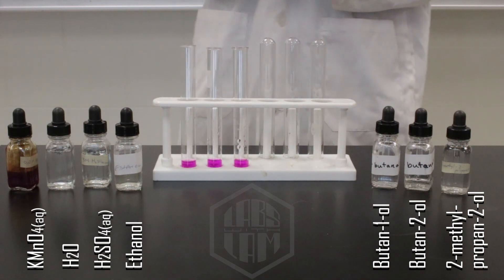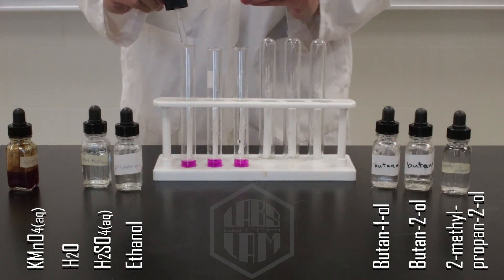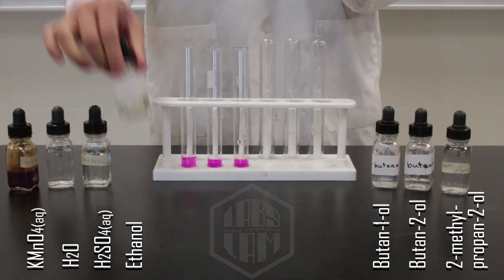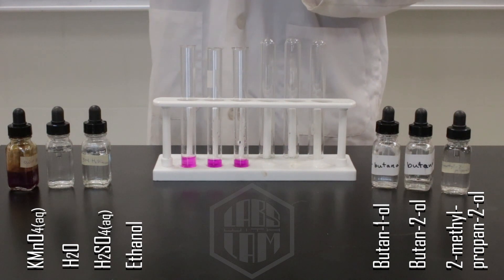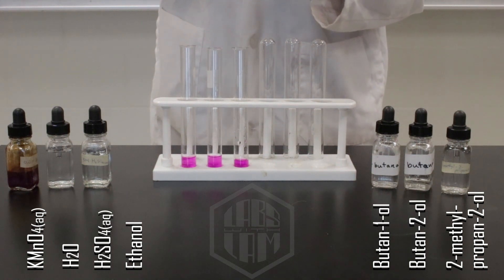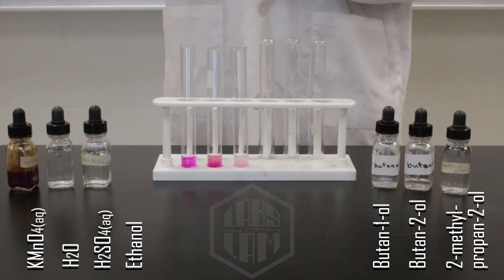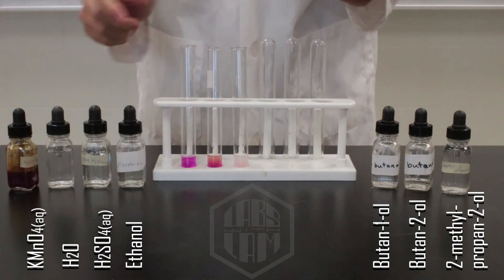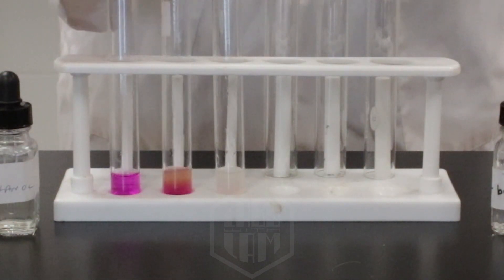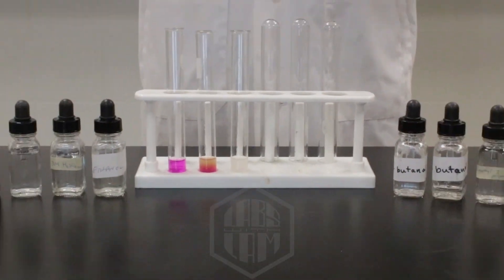Now I'm going to add a bit more water to the first test tube for volume consistency, and then I'm going to add ethanol to the other two test tubes. There's no reaction happening in the first test tube, but we can already see the beginnings of a reaction in number two, and number three has reacted completely. I'll give you a second here to make your observations, or feel free to pause this video for more time.